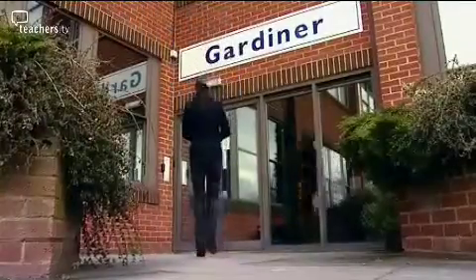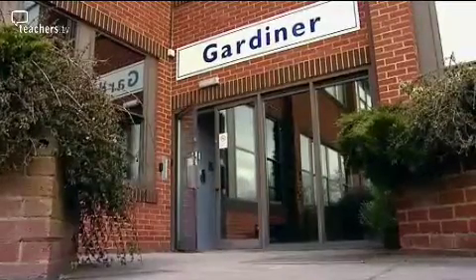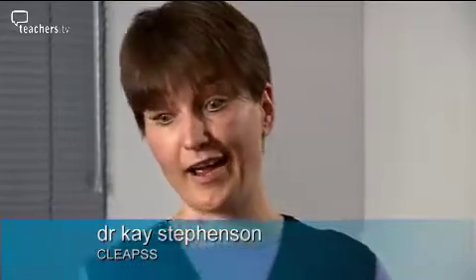I've come here to CLEAPSS, the school science support service, to meet 3 chemists who'll be guiding us through our chart. CLEAPSS runs a helpline for teachers and technicians to ring in with any problems that they've got, things they need to find out about. And what we've done is we've had a look at the records of all the helpline calls that we've had and picked the ones that we get the most helpline calls about.